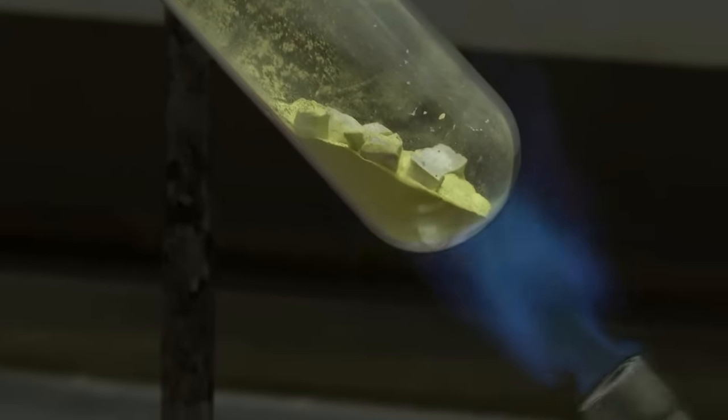So we put it on one of his heat proof mats and he started with a conventional gas torch. And after much heating, it glowed a little red, but nothing very much happened. So Neil got a bigger gas torch that had both oxygen and natural gas and tried heating it with that. And it got red and it got redder, but it did not obviously burn.